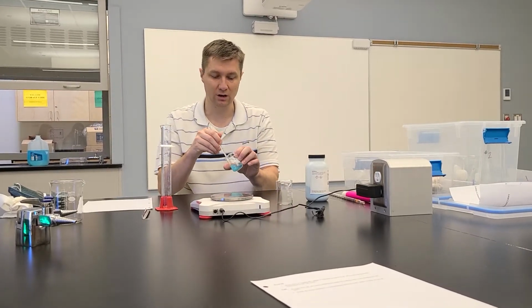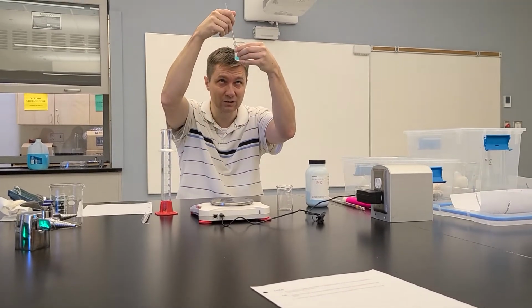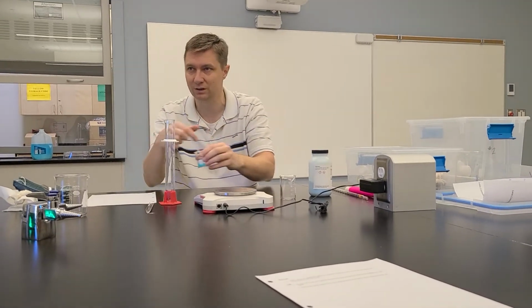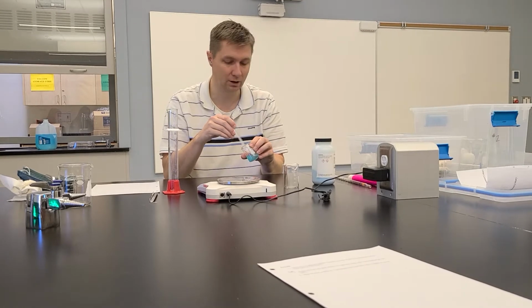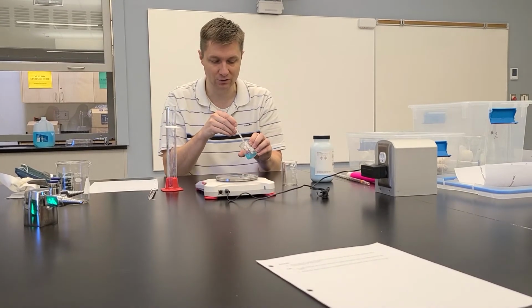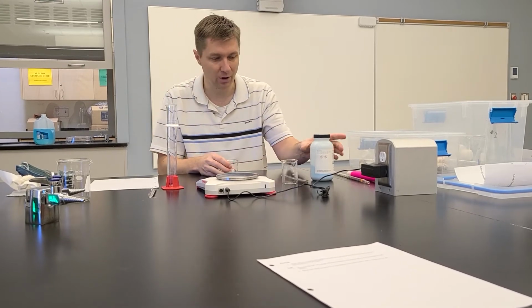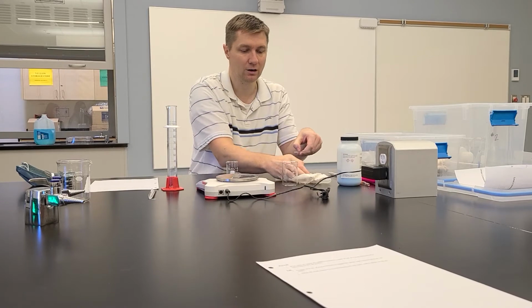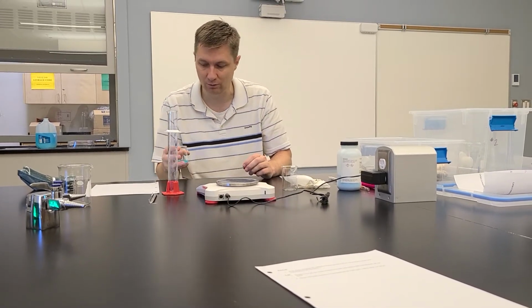The biggest trick here is to make sure, for sure, that your crystals are all dissolved in the solution, okay? Because if you go to transfer and some crystals are left behind, now it's not going to be the right concentration, okay? So really make sure that this is stirred up nice and good and that all the crystals have been dissolved. I'm probably not doing this as well as I should. You should have a couple pieces of paper towel here just to set things that are wet on them so you're not making a mess on the table.